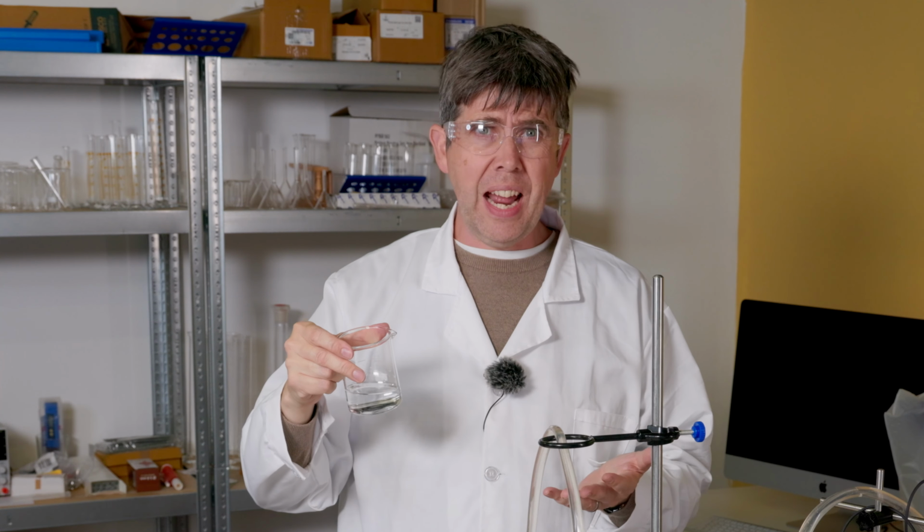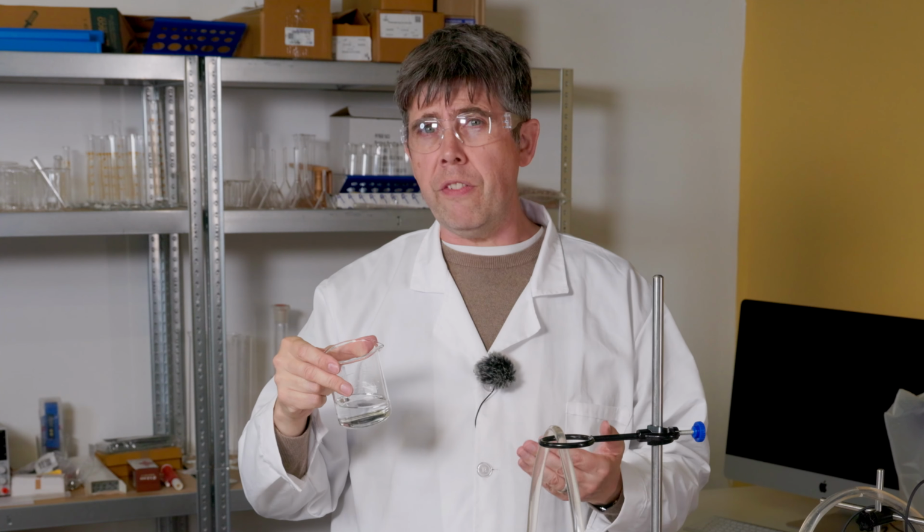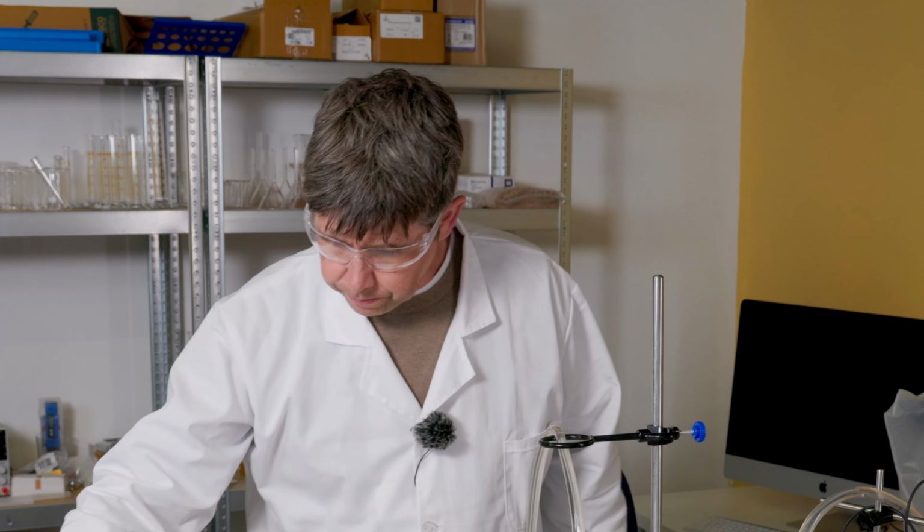Remember that every liquid evaporates to some extent, and the closer we get to the boiling point of the liquid, the more of it will evaporate. Let's look at another example where this is going to be critical.